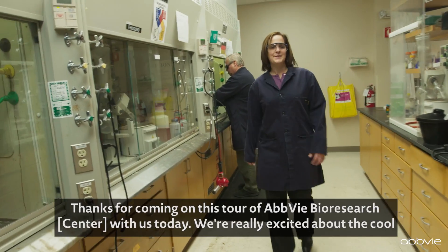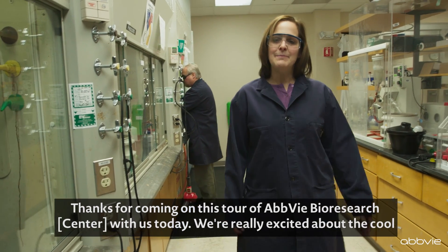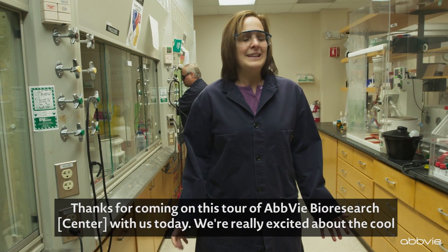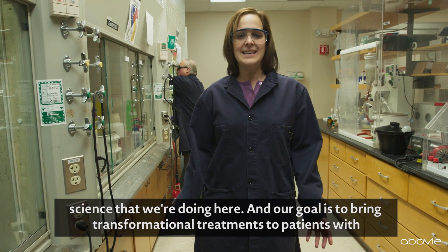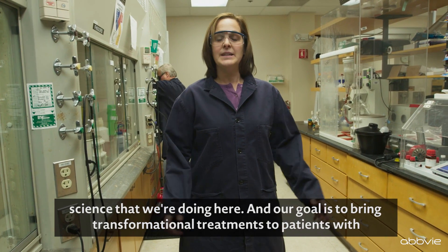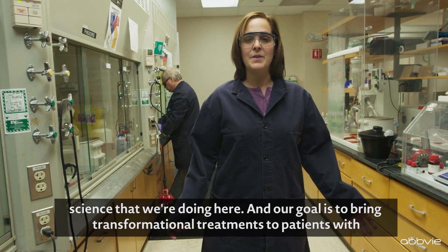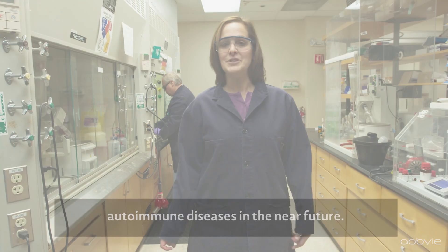Thanks for coming on this tour of AbbVie BioResearch with us today. We're really excited about the cool science that we're doing here, and our goal is to bring transformational treatments to patients with autoimmune diseases in the near future.